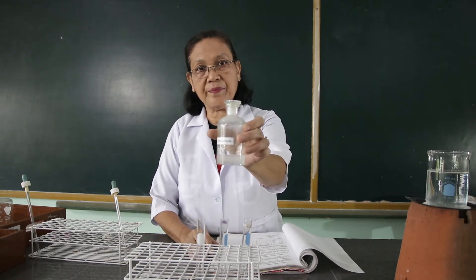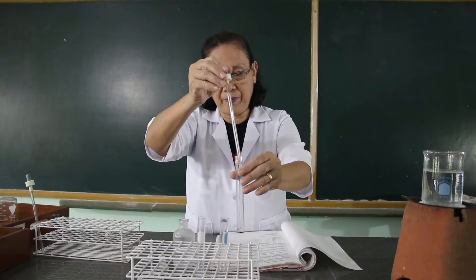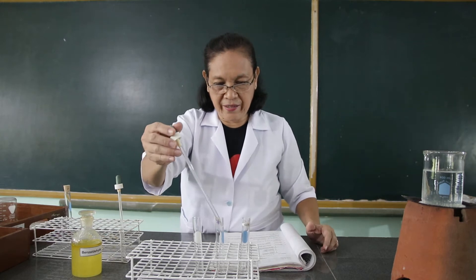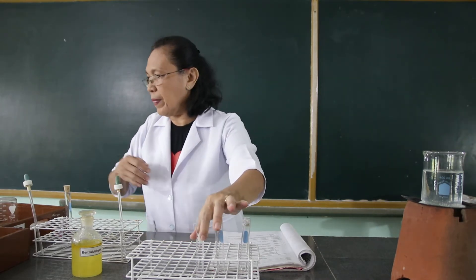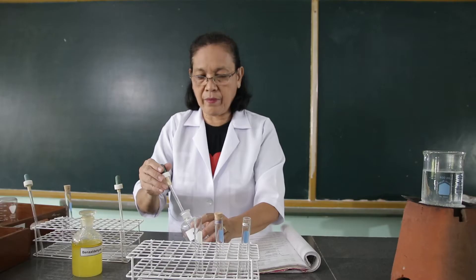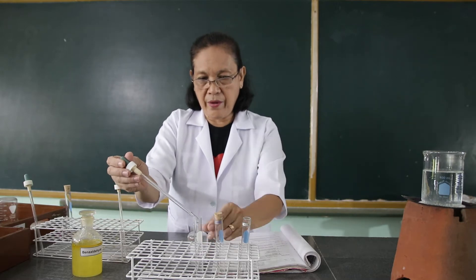This is the formaldehyde. We are going to place this into the first test tube. To the second test tube, we are going to put the benzaldehyde. This is the benzaldehyde — it is an aromatic aldehyde. We are going to put the benzaldehyde into the second test tube. To the third test tube, we are going to put the acetone. This is the acetone, and we are going to place this into the third test tube.